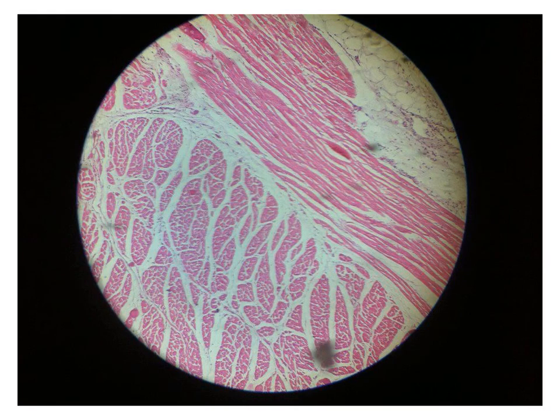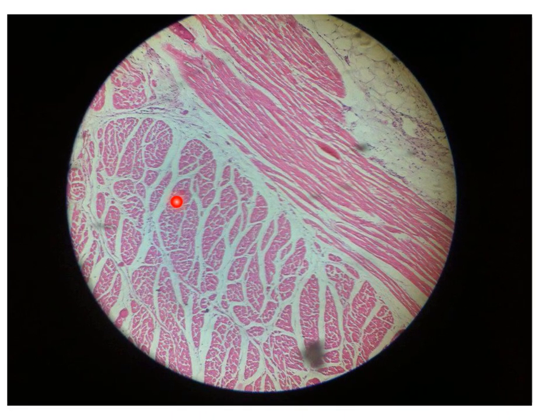This is the other slide, which is the cardiac muscle and valve. Of course, you should examine all of the slide by moving it sideways. And the most important thing here, you will notice the cardiac muscle is cut in different directions. We have longitudinal direction, like these ribbons, parallel to each other, and we have transversely cut cardiac muscle fibers. So we have two directions, not one direction, and in addition, of course, to the presence of the elongation of the valve coming out of this mass of muscle.